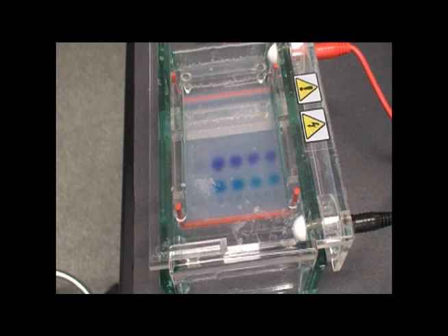Confirming that the gel is running can be achieved by viewing the motion of the samples down the gel, as shown here. After the gel has run, it is possible to view the bands under blue light. This image will be used to analyze the outcome of the lab.